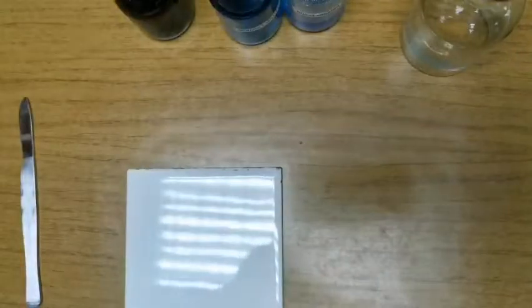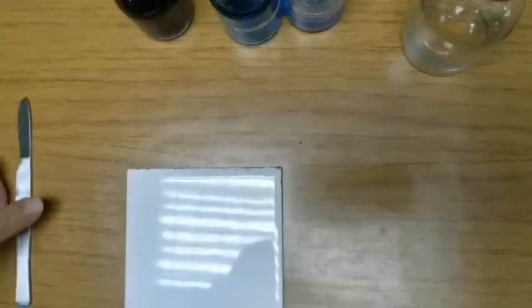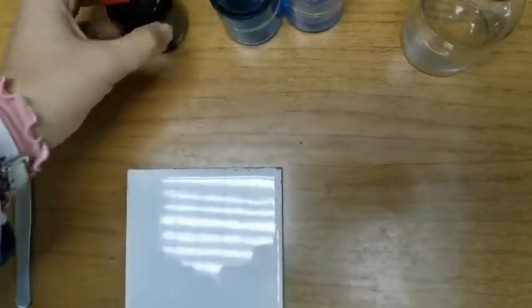Here is a short video demonstrating how you conduct a food test according to O-level standards. The main foods that are tested for are starch, using iodine solution.